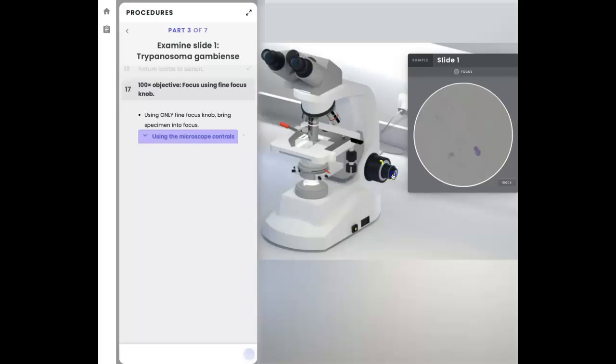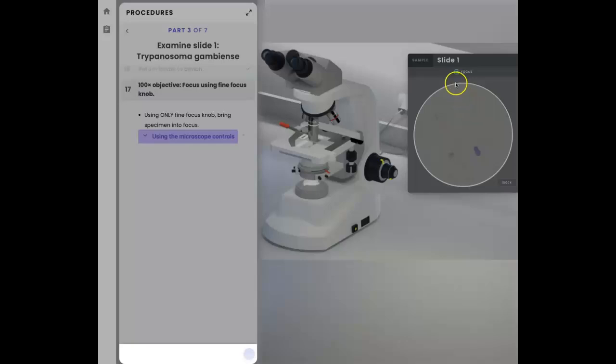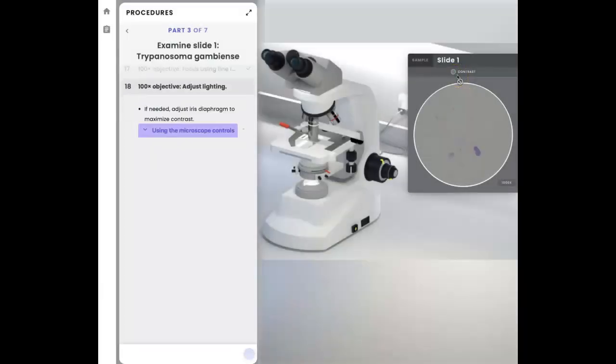So here I am encountering a little bit of glitches on the knob, but I'm beginning to see that it's getting sharper. I don't see the check mark showing up yet, so I just went past it and I did not see the check mark. So I'm going to go back very slowly. So this is kind of tricky. There we go. There. If I were in the real lab, I would say that this is super sharp. But let me keep going a little bit more counterclockwise. There. I see now the check mark. So that's what they consider perfectly focused.